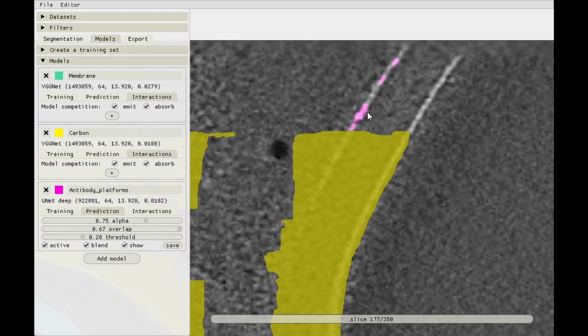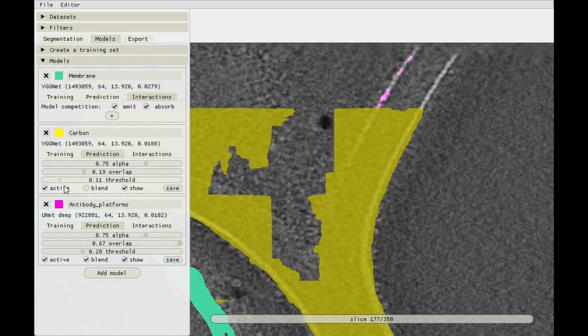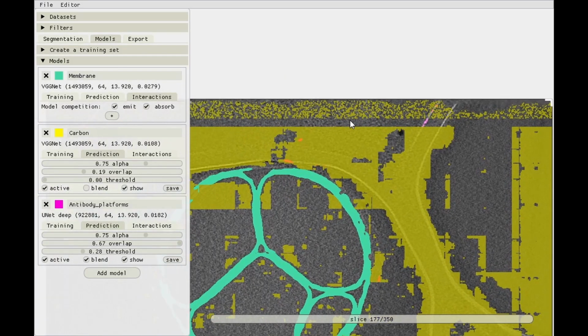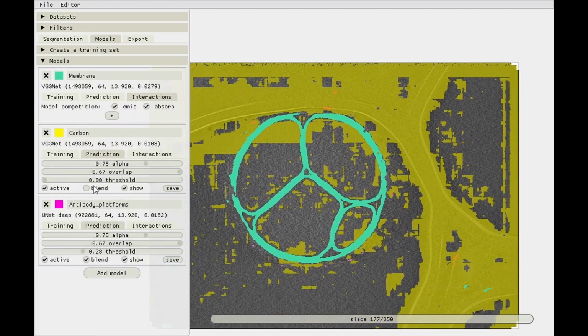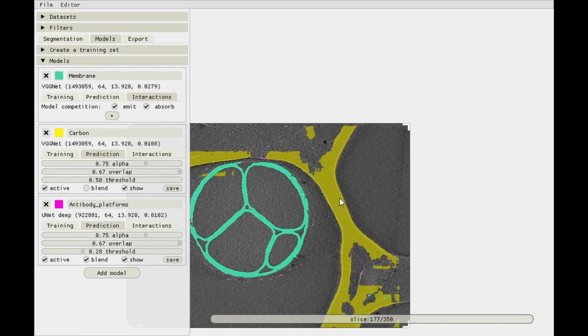So there's a pink blob, and then in the next slice there's actually another pink blob. So it's not what we want. So this one is a problem. It's close to carbon, and it also absorbs the competition from carbon, and you can see that we have this overlap artifact over here. So at the edges of the data, the predictions can be a bit off if the overlap is low. So let's set the overlap to the maximum value to get the carbon model to work better, and we've put the threshold to 0, which is not great, so let's set that to 0.5 or something like that. And this is only for visualization, by the way, so the threshold that you set here does not affect the emission and absorption competition. It can affect the interactions one, but we'll get to that in a minute. But anyway, we've now fixed this bit.